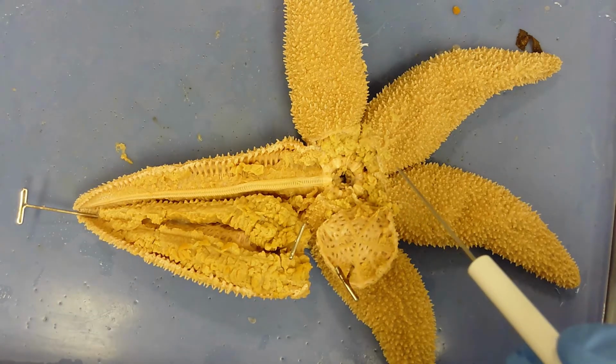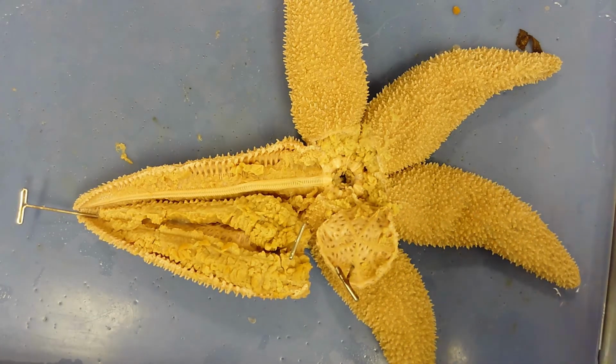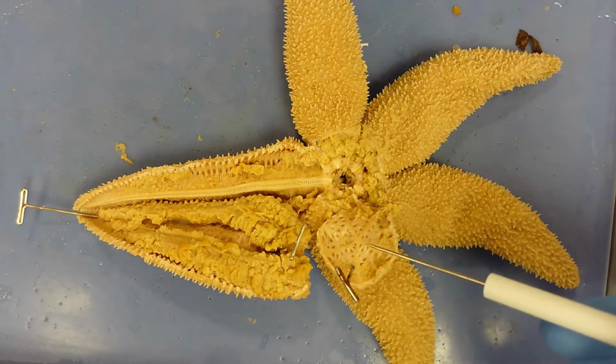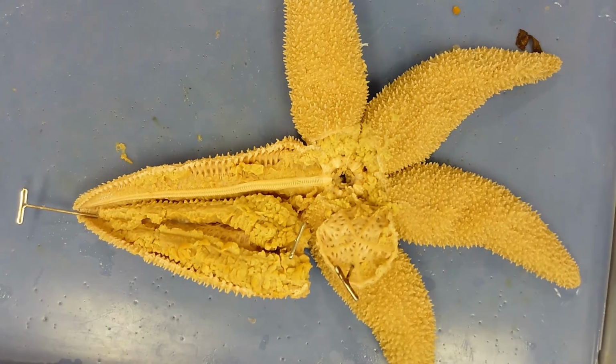If you think of the stomach of a starfish, it's shaped like an hourglass. The bottom side, or the oral side, is the cardiac chamber, and the top side of that hourglass is the pyloric chamber. That pyloric chamber is connected to this point where these lines meet, and this is the anus right here. All food waste is excreted out through that pore, the anus.